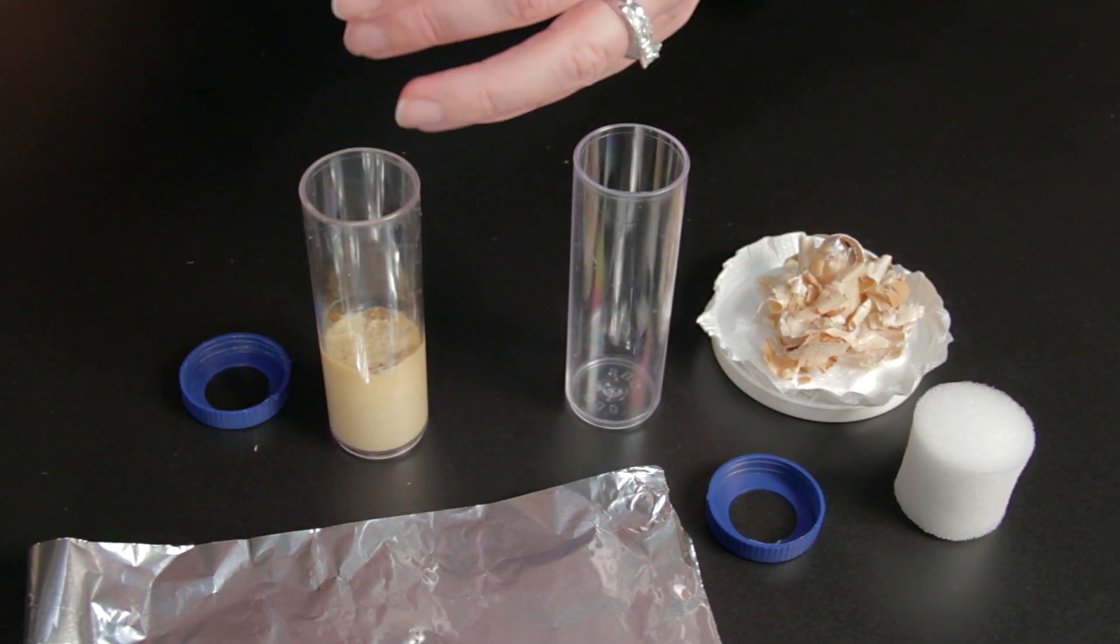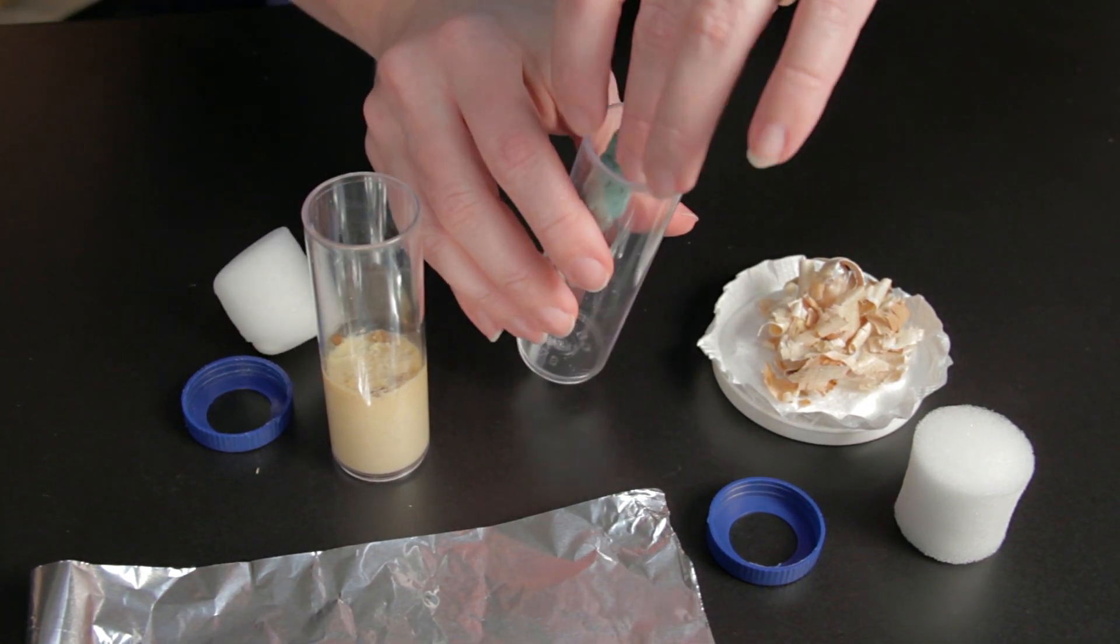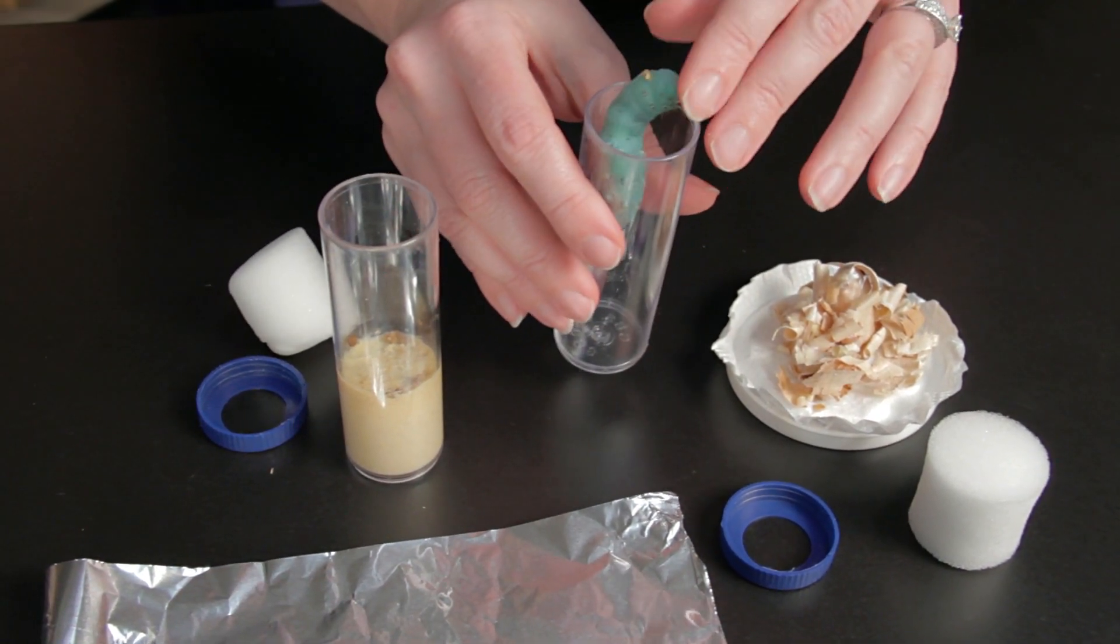Remove the mature larvae from the vial. Thoroughly wash the vial with hot water and dry it. Do not use soap or detergent.